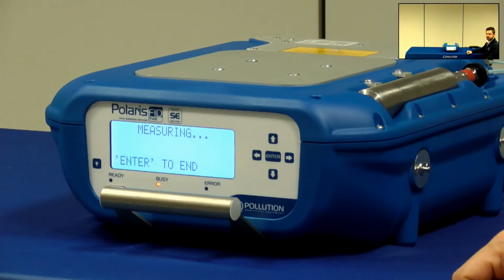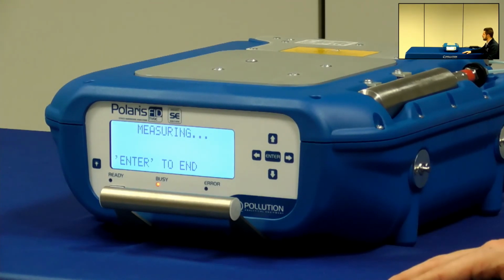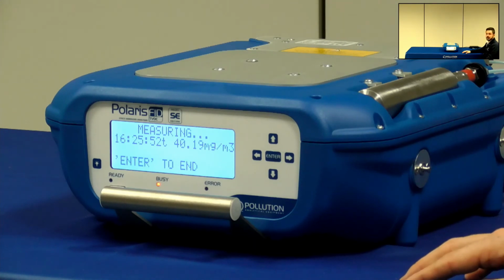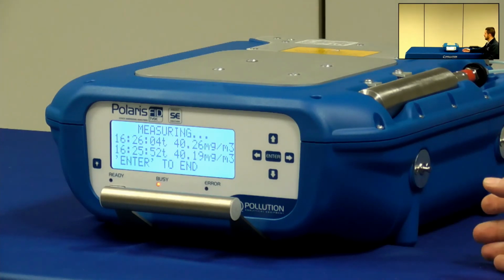Then, going to read span, it is possible to check if the instrument is still calibrated. So in this case, I'm using the integrated disposable cylinders, and I'm expecting a concentration of milligram of carbon very close to the one specified in the bottle label. Also here you need to wait few measurements before the value stabilize, and if the span check is within your requirements, you can finally proceed and start the monitoring campaign.